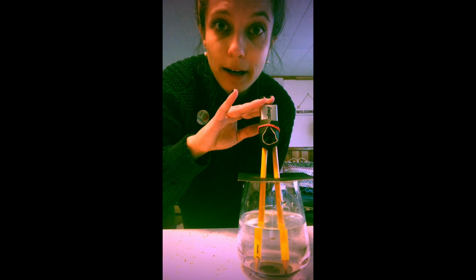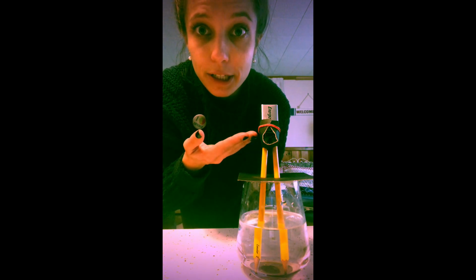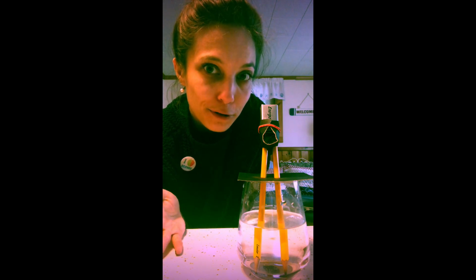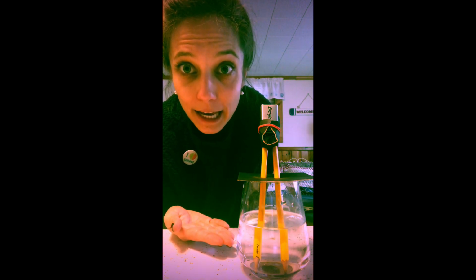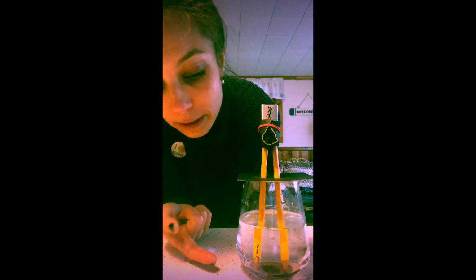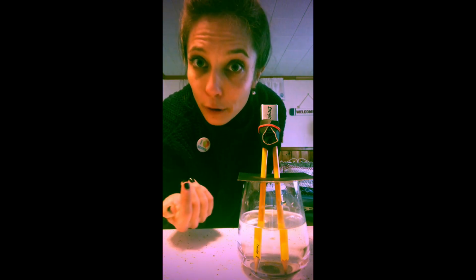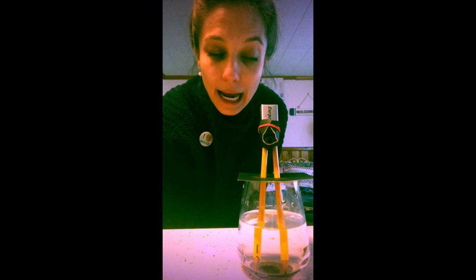Now that I've added our graphite conduits to our 9-volt battery, remember, our 2 reactants are water and energy. Our products are going to be hydrogen gas and oxygen gas. Maybe something else too. But I just wanted to show you that I haven't added any NaCl, any salt, to our water yet. So our water is still currently a very poor conductor of electricity. Notice there are no bubbles coming from either conduit, right? Remember, we have a cathode side and an anode side. The anode side is going to be our positive side, and the cathode side is going to be our negative side.